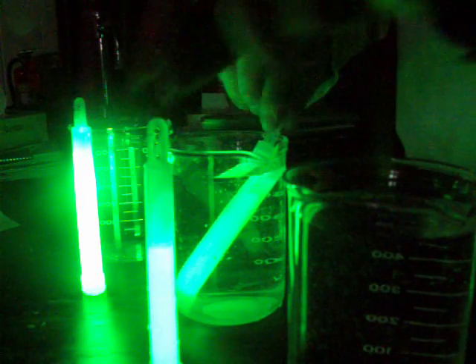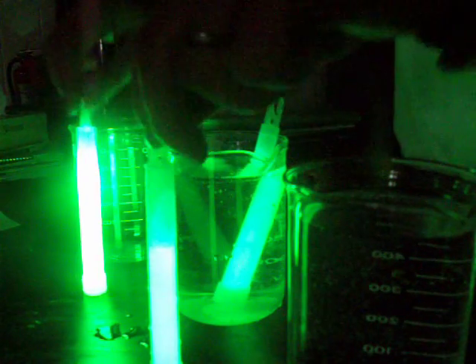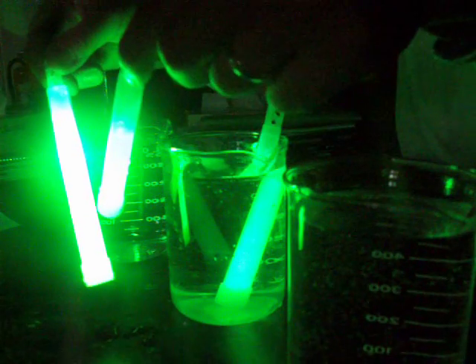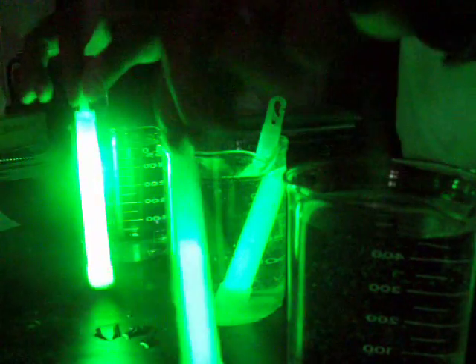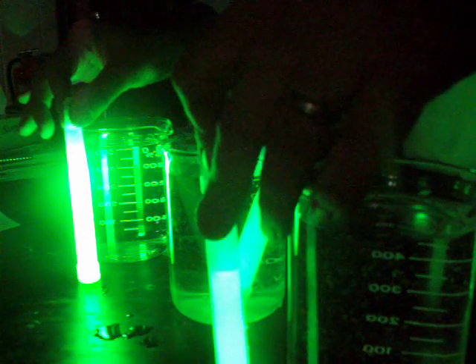And remember, they were all glowing about the same brightness to begin with, but pretty significant brightness differences there. And that's probably due to the temperature.